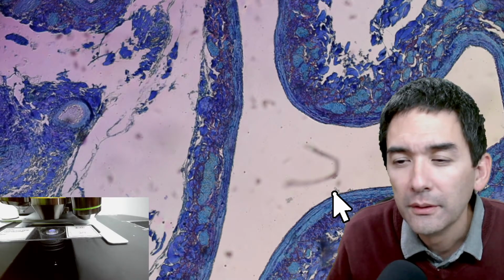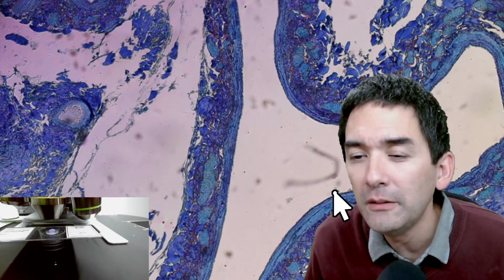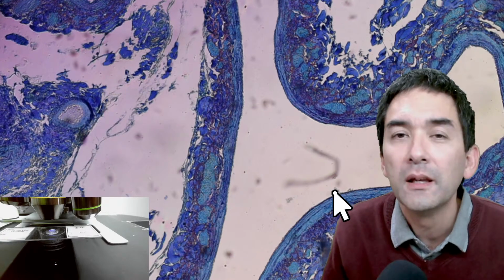So, a few more questions and then I'm done, I'm already talking 1 hour 15 minutes. I'm already feeling a little tired. How would you compare the optical quality of this new scope compared to your previous Olympus?